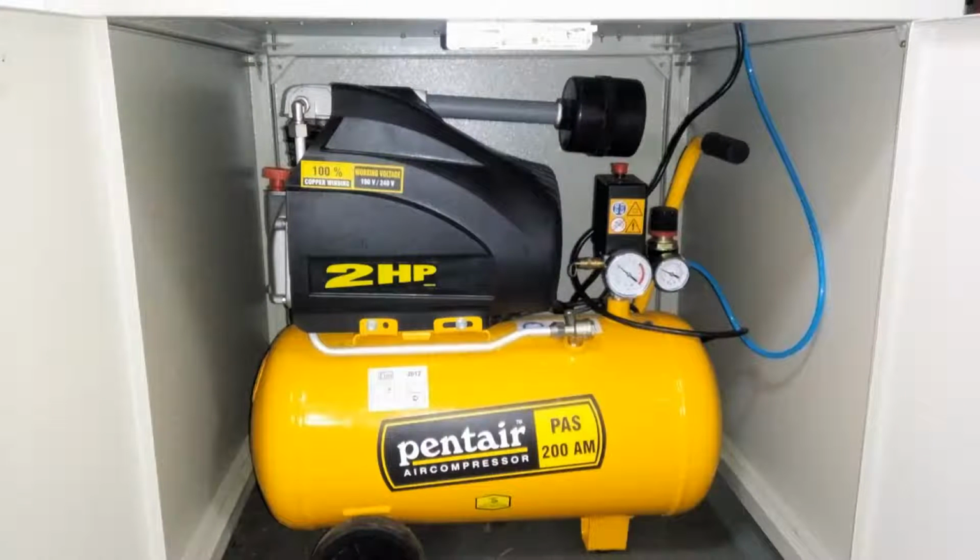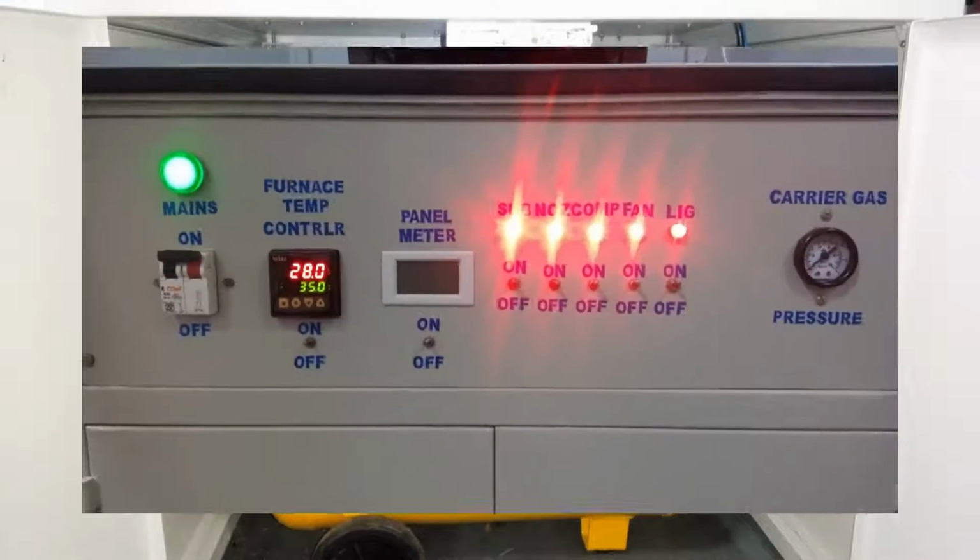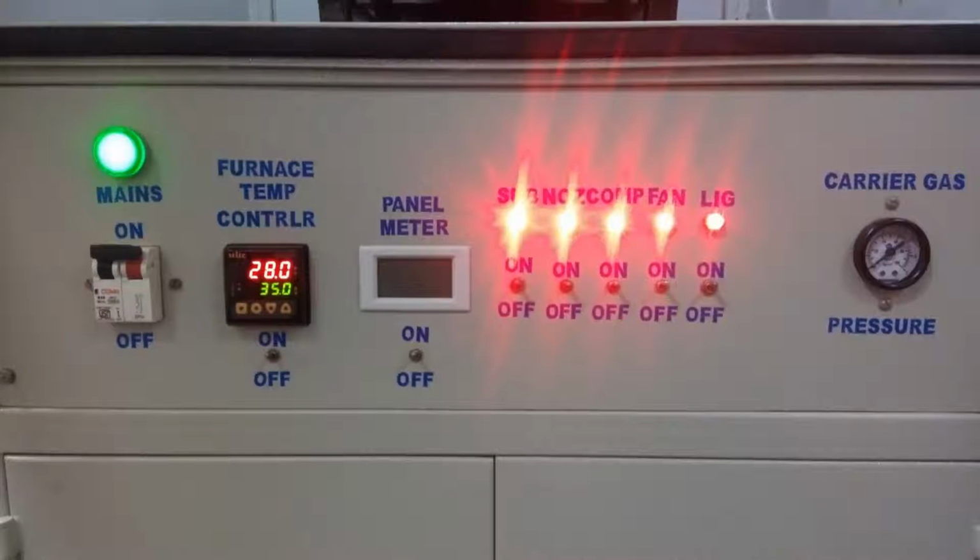This is the photograph of the compressor placed in the lower compartment of the unit. The on and off control of the compressor and the opening and closing of the air are completely automated. Only the flow value should be preset using the manual flow control arrangement. Instead of the compressed air, a particular gas can be used for the deposition. This photograph shows the control panel of the instruments, which has manual controls and indicators too. Here, the panel meters show the actual voltage, current, and power consumed by the furnace during operation.